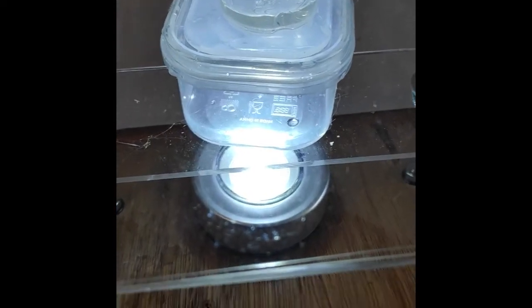So here we are, putting the camera down flat and finding the lens. Then we can adjust the sample tray to find focus. Caitlin, what are those things there? That's algae. It's amazing. Every step you make, it wobbles — just stop still. Now take one step. Isn't that amazing? It's so magnified.